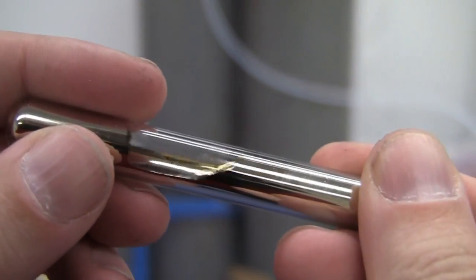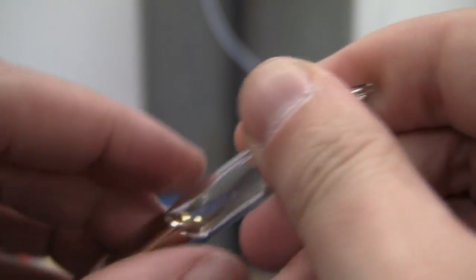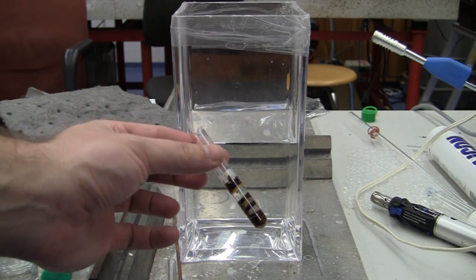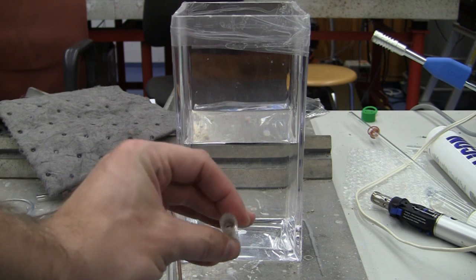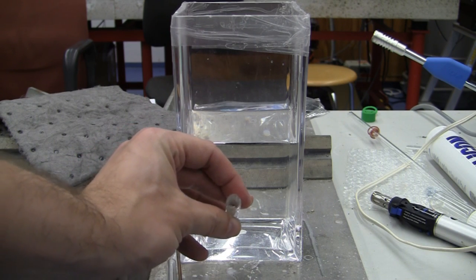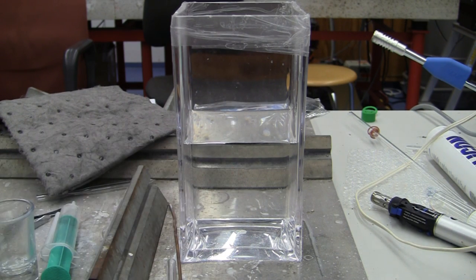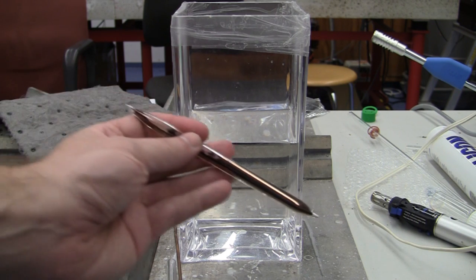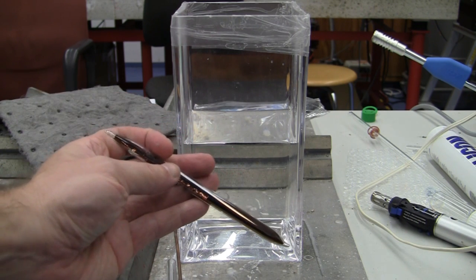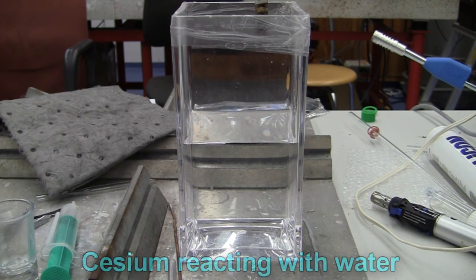Had concerns whether it'll ever actually sit in the syringe anyway. Okay, so we've done all the reactions we can with the cesium. This is almost empty, so I've sealed up what I can with what equipment I can. So in like half a mil maybe.